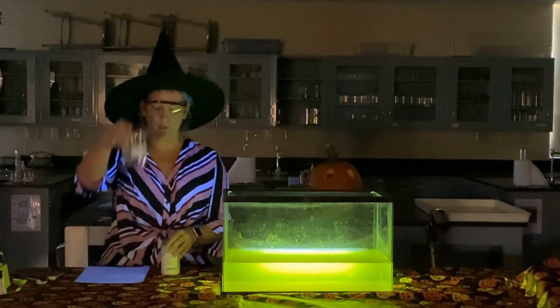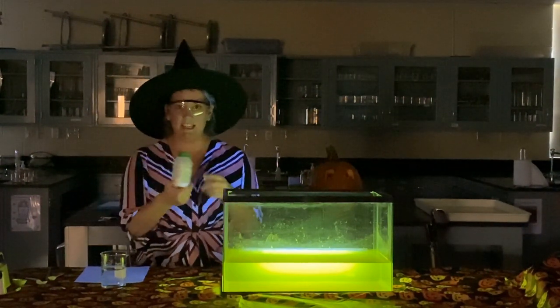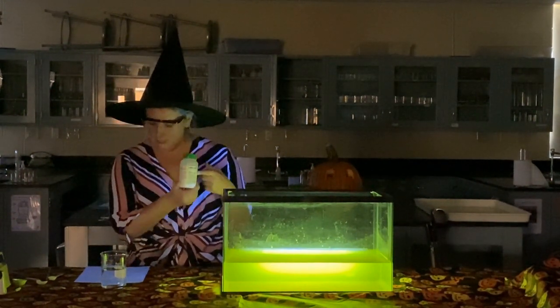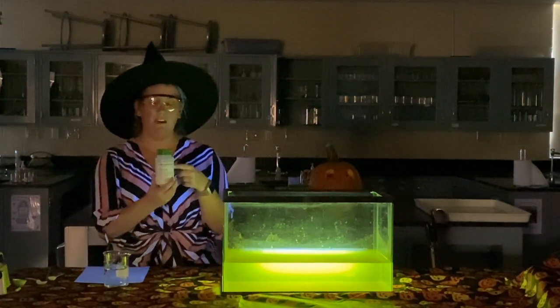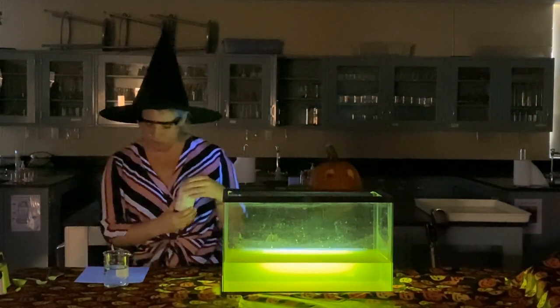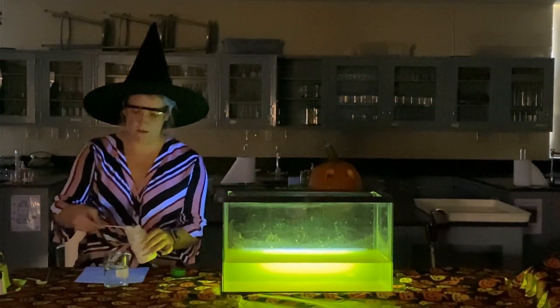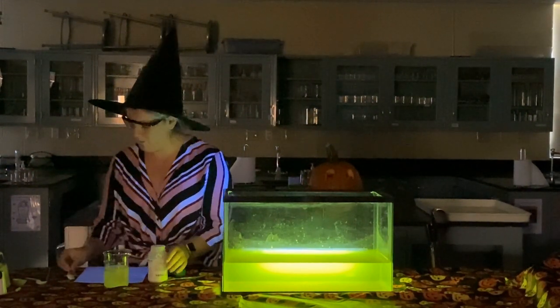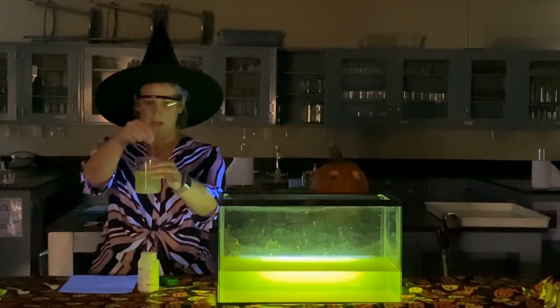So here I just have a beaker of water, and I'm going to add a chemical that's labeled as instant light. This instant light contains luminol, and when I add it to the water, it's going to have an oxidation reaction, and that's where we'll see that light being produced. Just a little bit of this. Just need to stir it up to see that chemiluminescent effect.